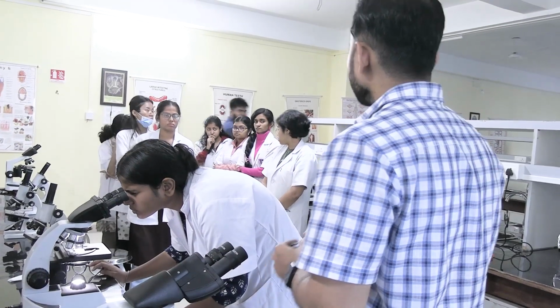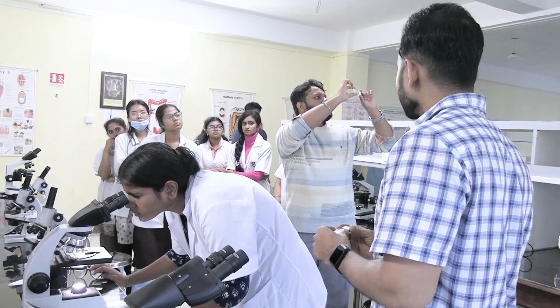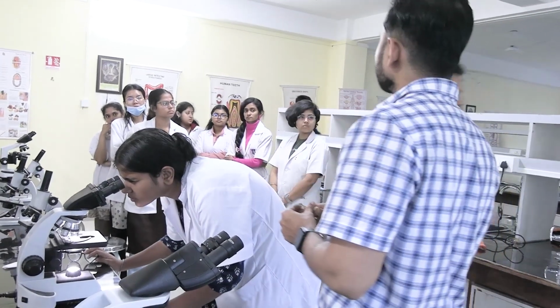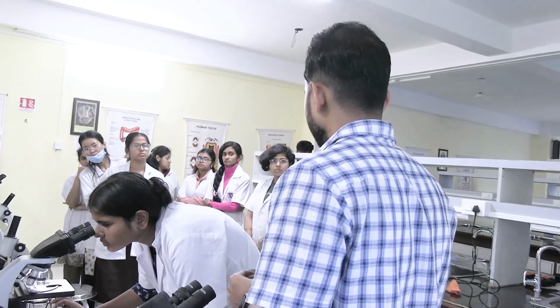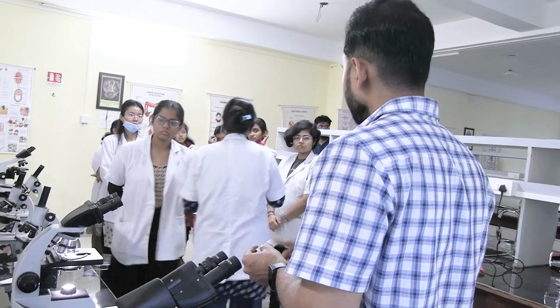Okay. So today we have slides of hyaline cartilage and elastic cartilage. Fibrocartilage is not there. So for fibrocartilage, you have to take the help of the diagram which I have shared. For the remaining two tissues, I will show you the slides.